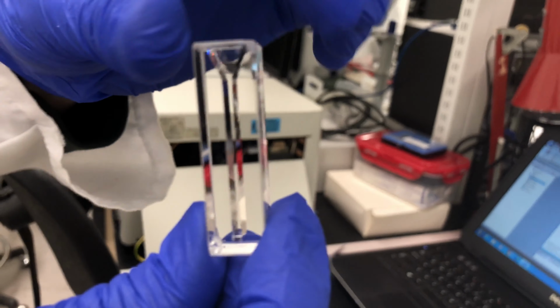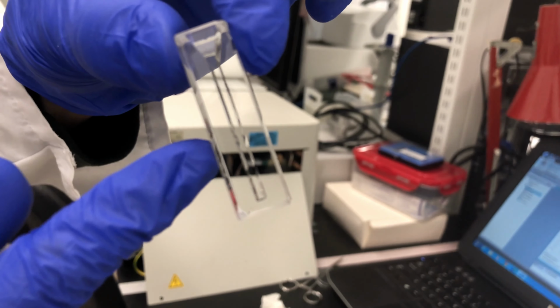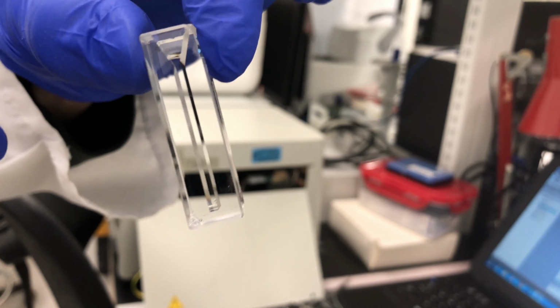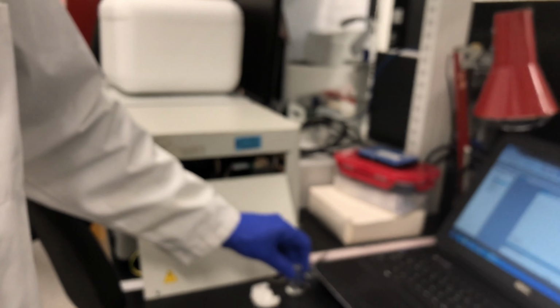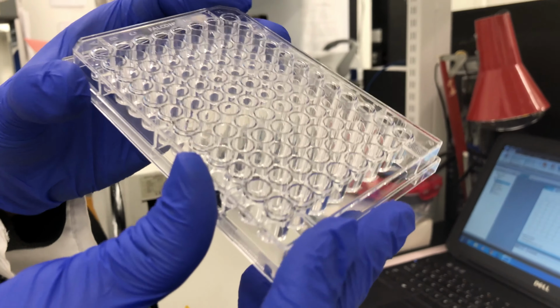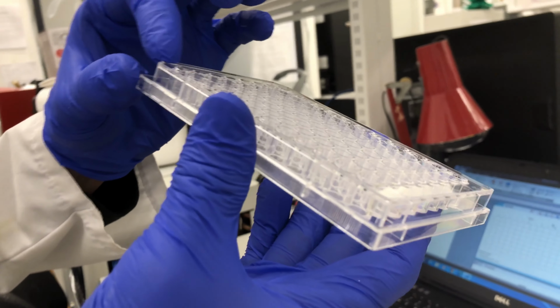Now, some of the drawbacks might be that because it's a glass cuvette, quartz cuvette, you might have a little bit of bending of the light, so it actually will not travel 180 degrees. It may bend a little bit, and not all of it will hit the detector. So that's the quartz cuvette. Now, this one here, the 96 well plate, the challenge you're going to have with this is that the path length will always be different based on your pipetting.